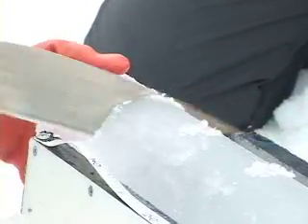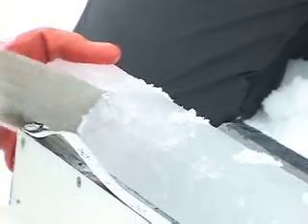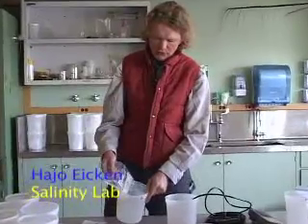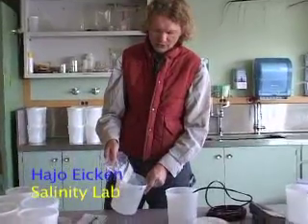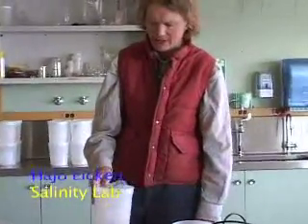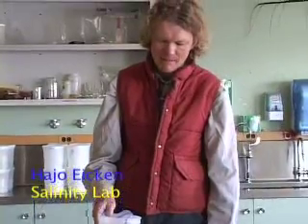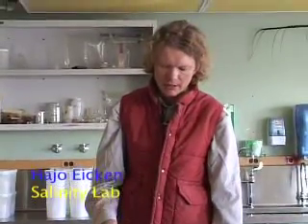We're measuring salinities. These are parts of the cores that we cut up on the ice. On the ice, we transfer the ice core into one of these Ziploc bags and then set it into one of these plastic containers and bring them in and melt them so that we can measure the electrical conductivity.